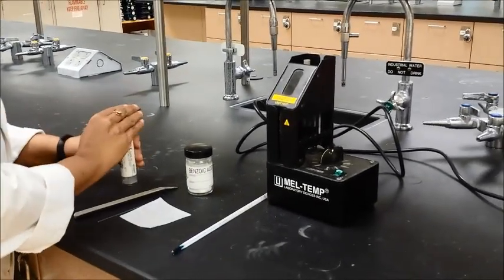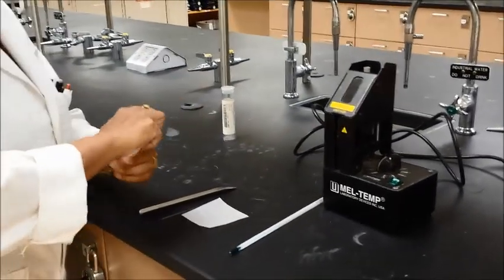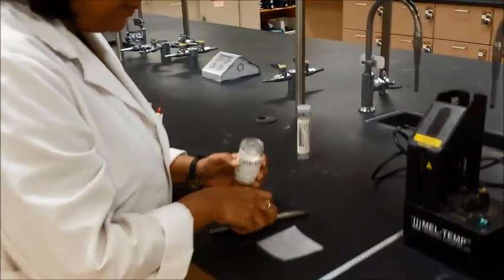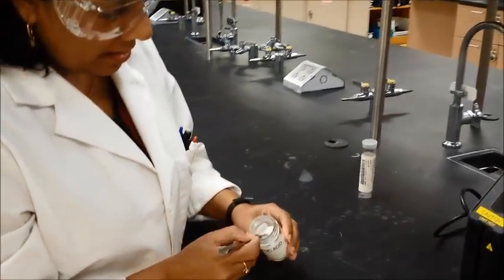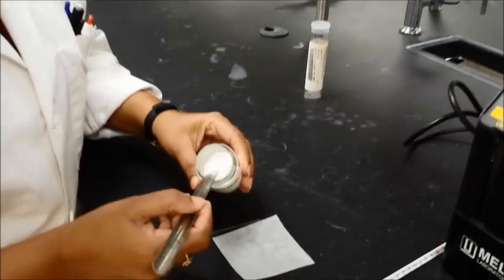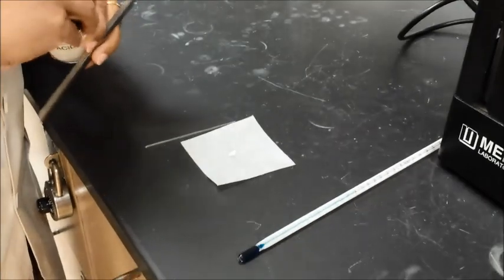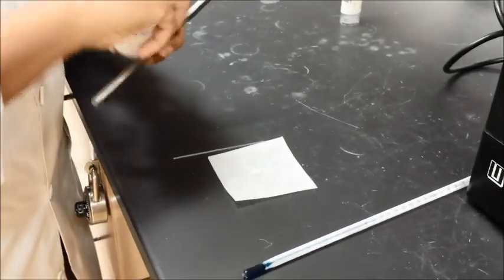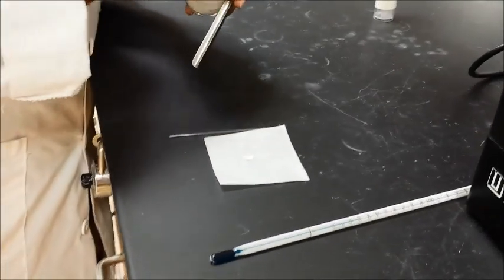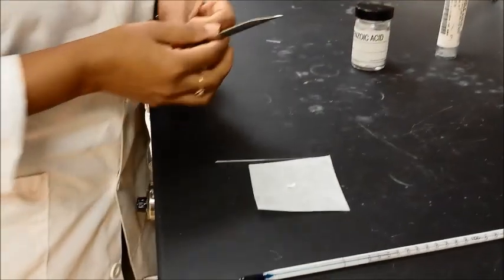So the way to start this process is to take a little bit of the sample and place that on the paper. You need a very little bit of the sample, you don't take too much of it otherwise it will be all wasted or you will have to throw it away, so don't take too much of it.